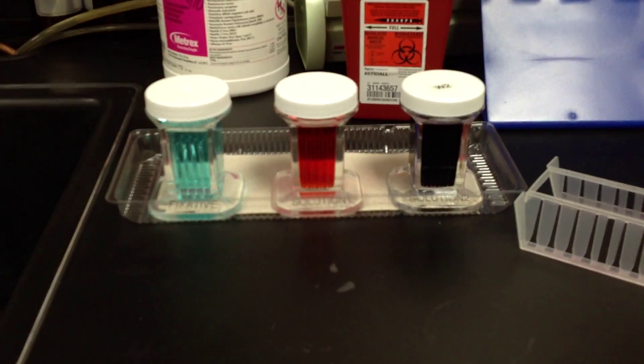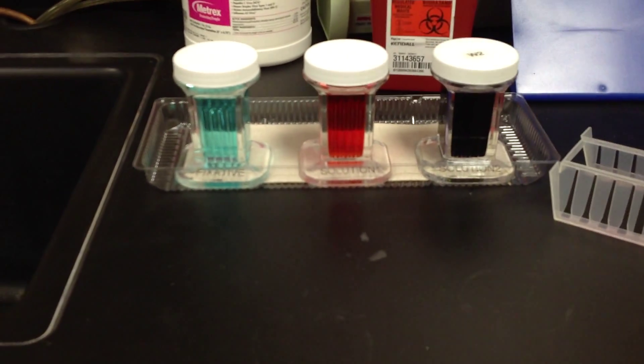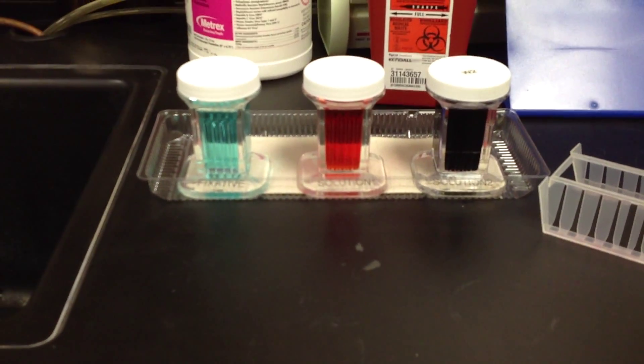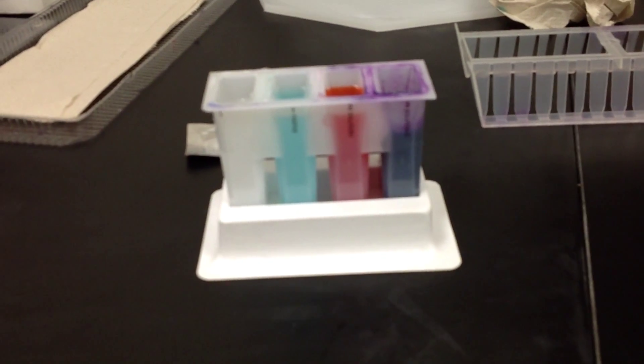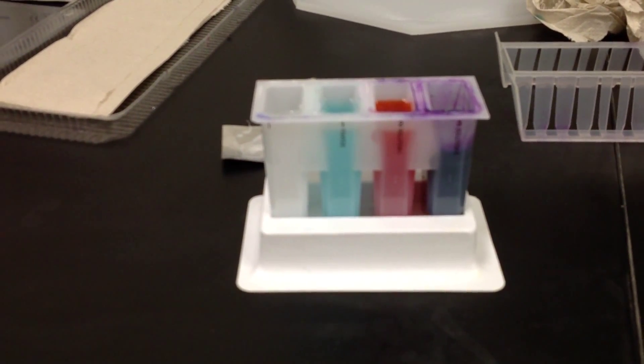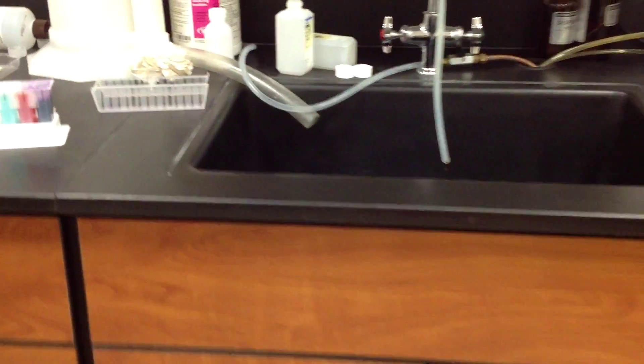We have two different setups: the individual stains in coplin jars with screw lids, and a disposable kit set that has just a covering on top. But they're the same stain, and we perform the same procedures with them.